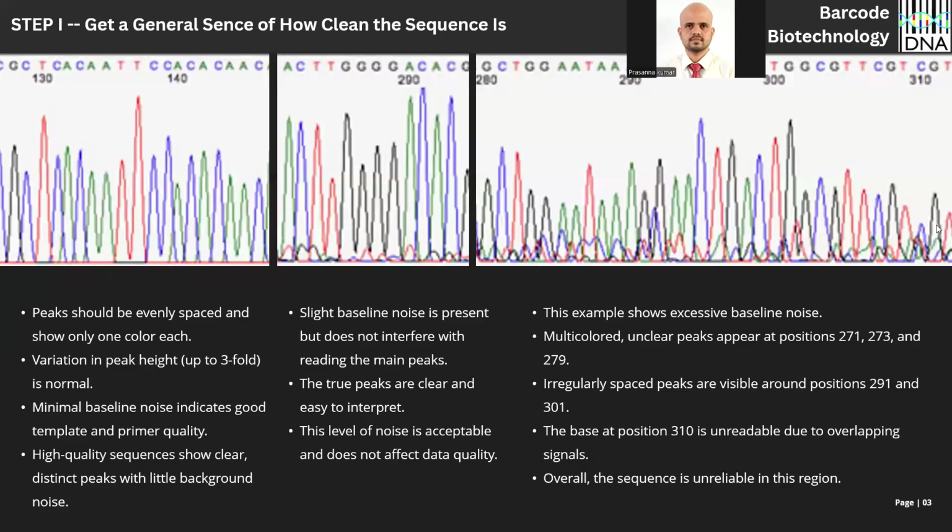So we are in step one. Before you start editing, just go through the chromatogram from the beginning to the end region. See how clear the chromatogram is. You decide yourself where you are going to focus, where you are not going to focus, just skip the run. This will give you a general sense of how clean the sequence is.